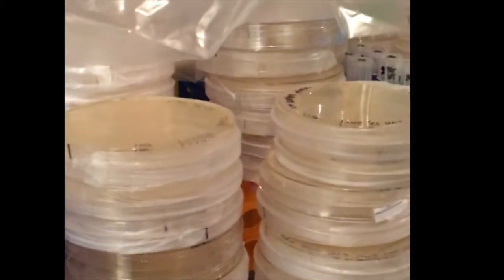Invert and store the plates at 4 degrees Celsius. Most plates should not be kept for longer than one month at 4 degrees Celsius and should be checked before use for contamination or dryness. Storage time can vary depending on the type of plate or type of antibiotic used. Some are more stable than others and some are photosensitive. Be sure to familiarize yourself with the components of your growth media prior to use.